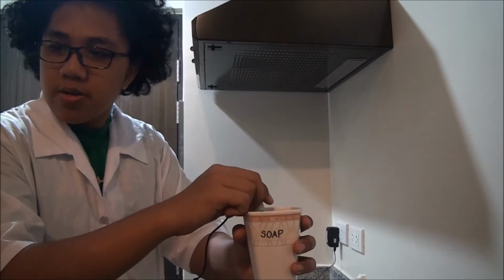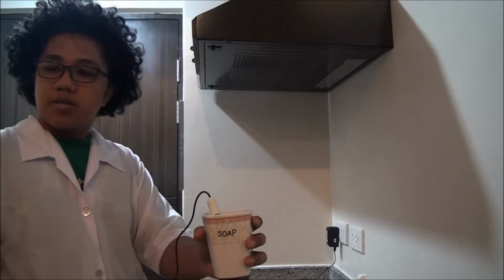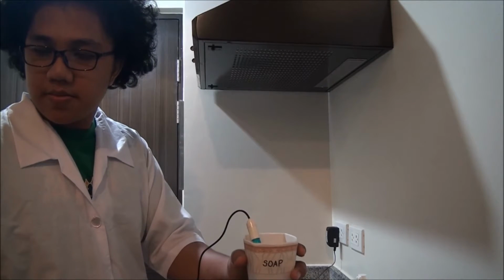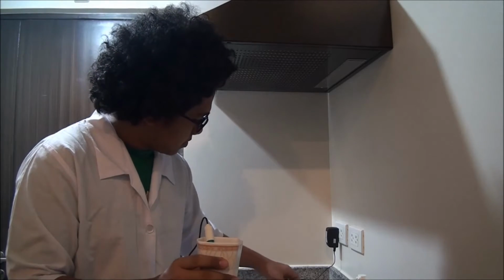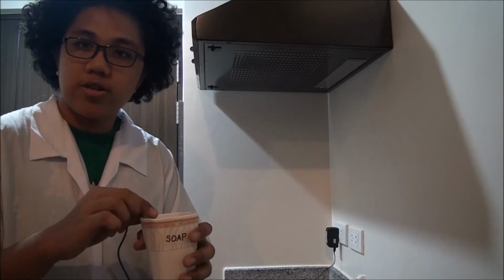So it seems that our device has disconnected, I think. So let me just reconnect it. Our remote device disconnected, so we're gonna have to reconnect it.